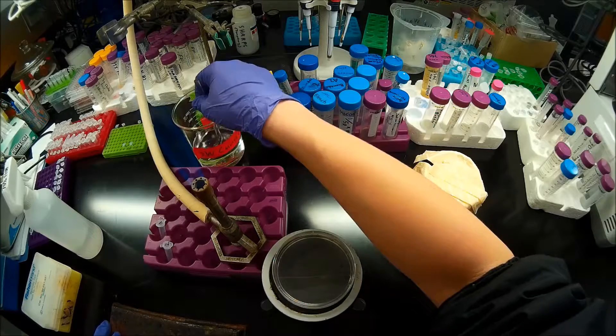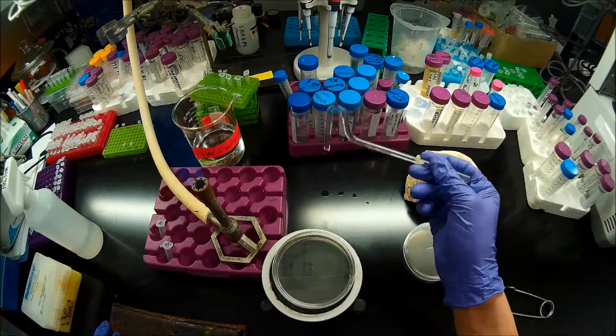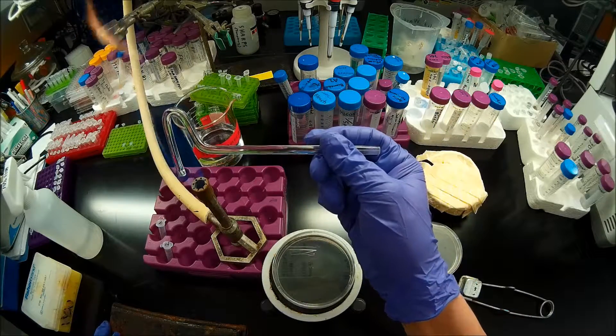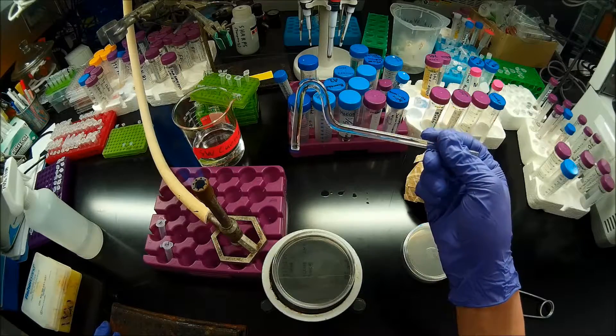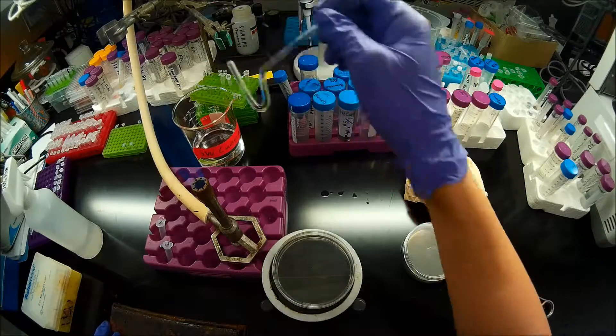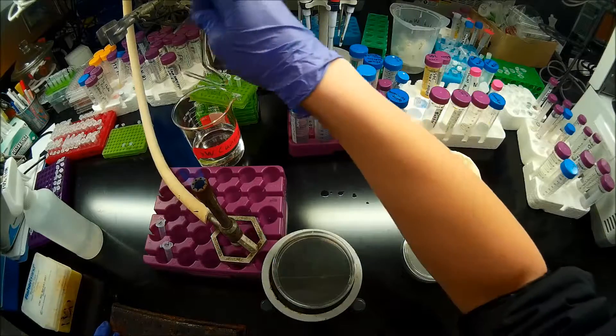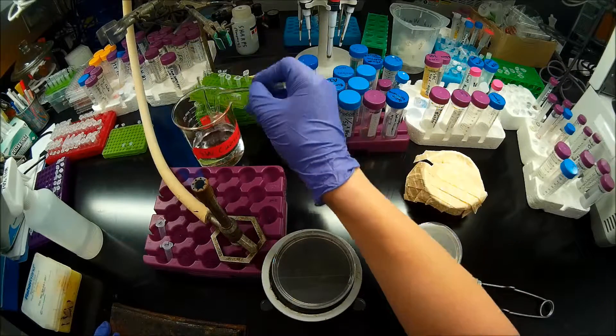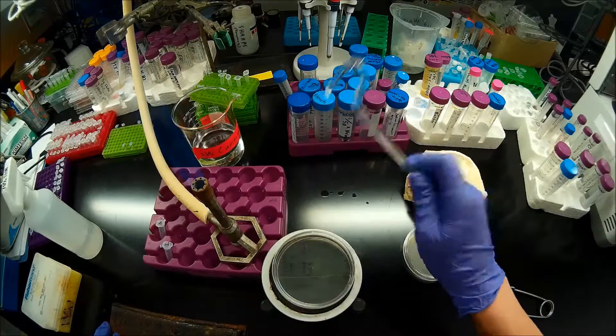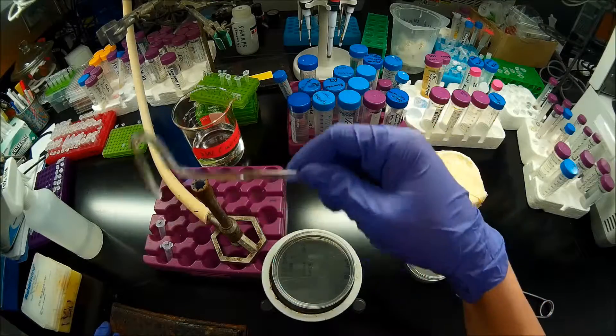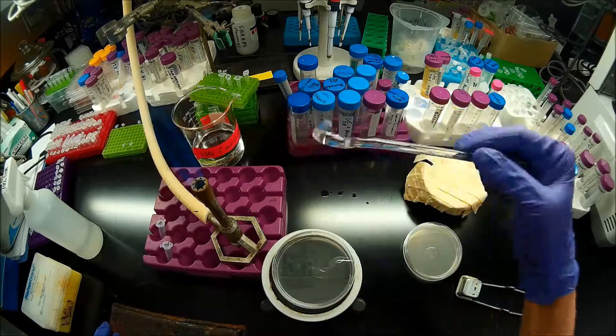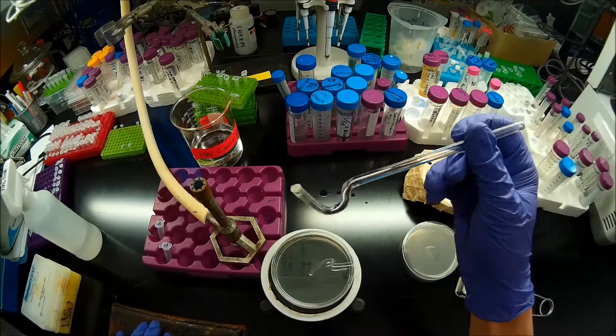I'm just dipping it in the ethanol, flicking off the bulk of the ethanol, but not too much, flaming it. I'll just pass that through the flame once to make sure that all the ethanol is gone.